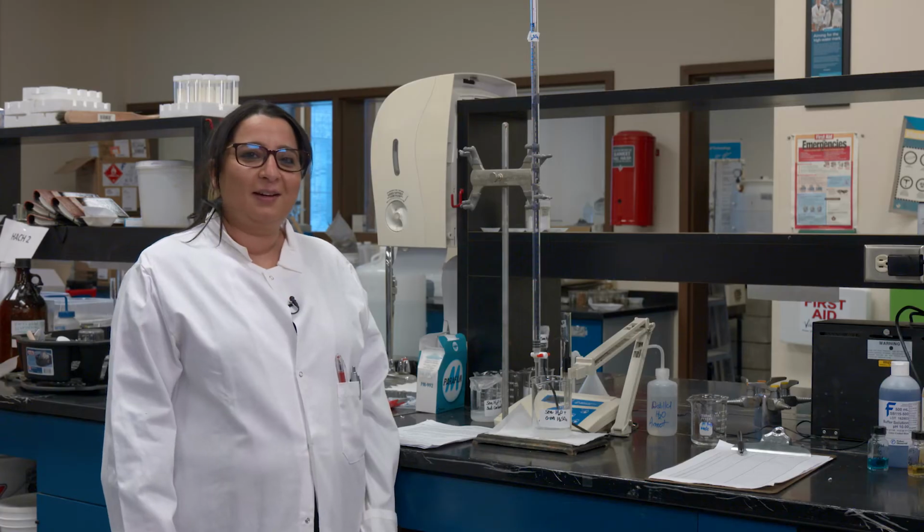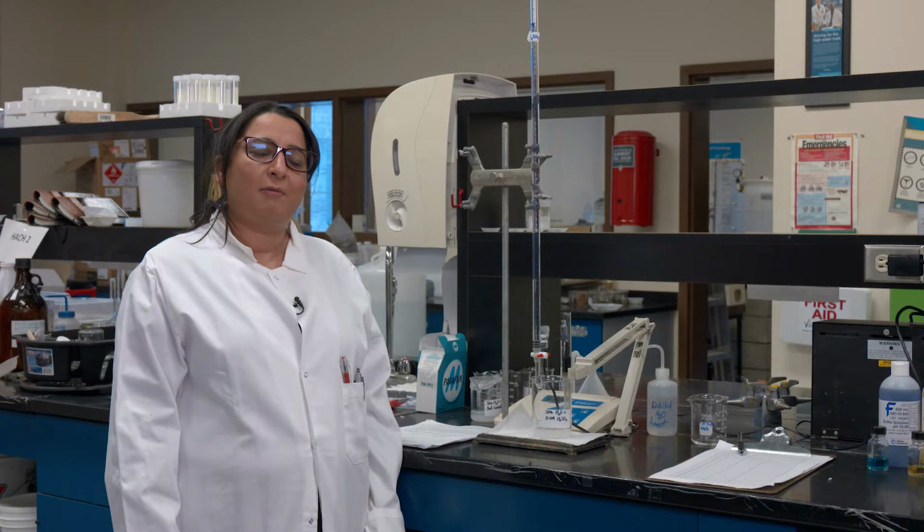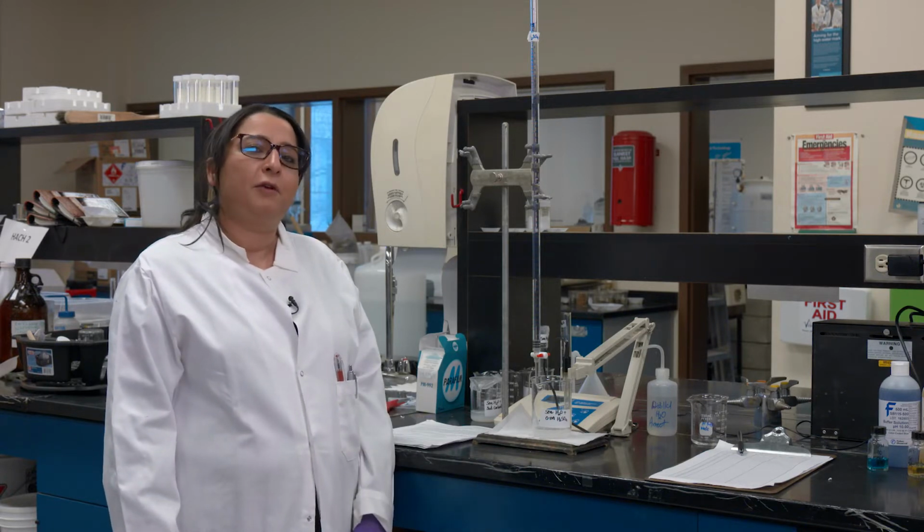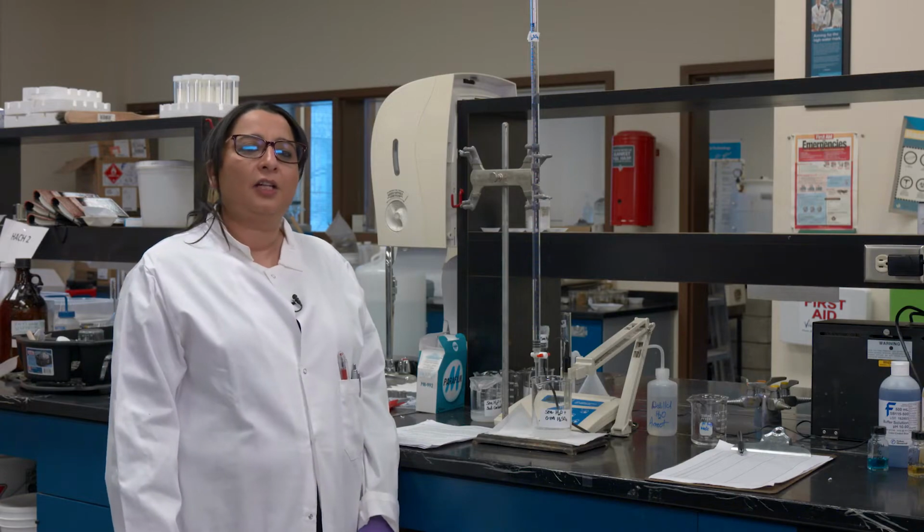Hello students, here we are for our lab for carbonate equilibrium, and I will be performing an experiment in front of you, but first a few words about the introduction. Aqueous carbonate equilibrium is a challenging subject, yes we all know that, but it's important and necessary because it helps us understand the carbon cycle and, of course, lately the impacts of increasing CO2 in the environment.